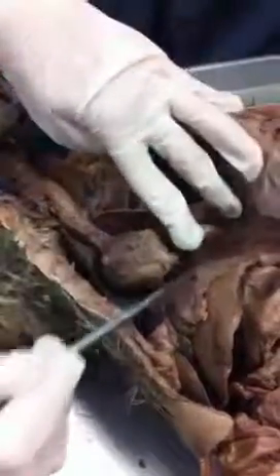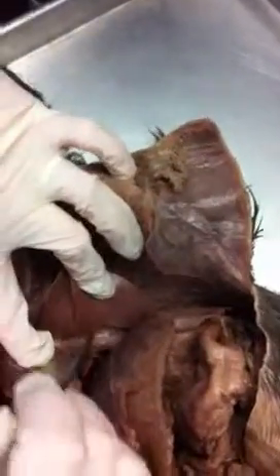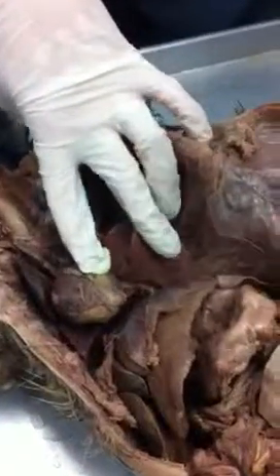Diaphragm. This part, just this flat part here. Diaphragm. All right. So I'm going to pull this open just a little bit, and I'll turn this around for you guys. Do you guys see this nice thick line running right there? That is your phrenic nerve. This one right here, and it innervates the diaphragm. So when you have the hiccups, it's the phrenic nerve.